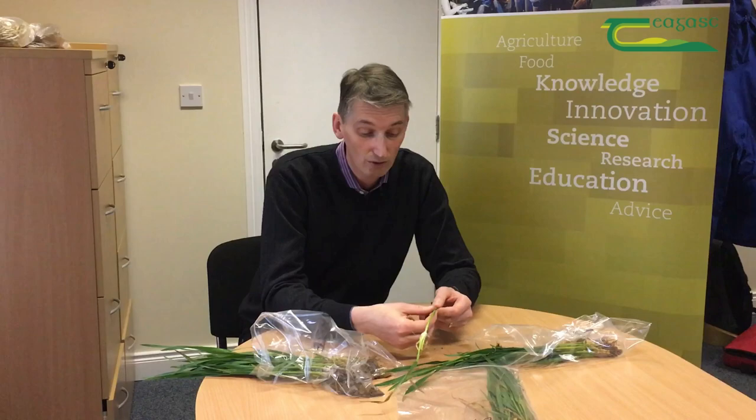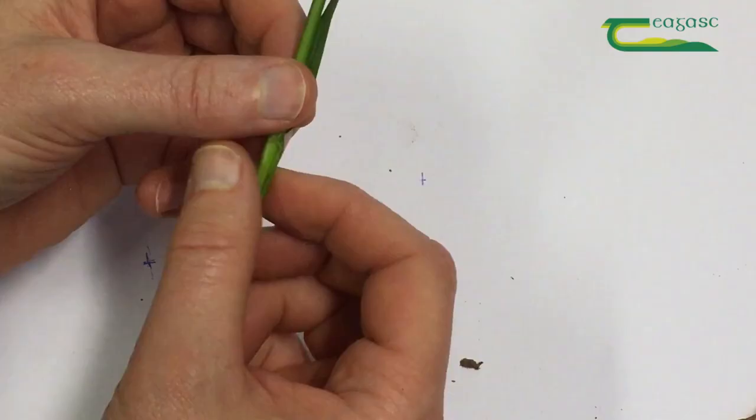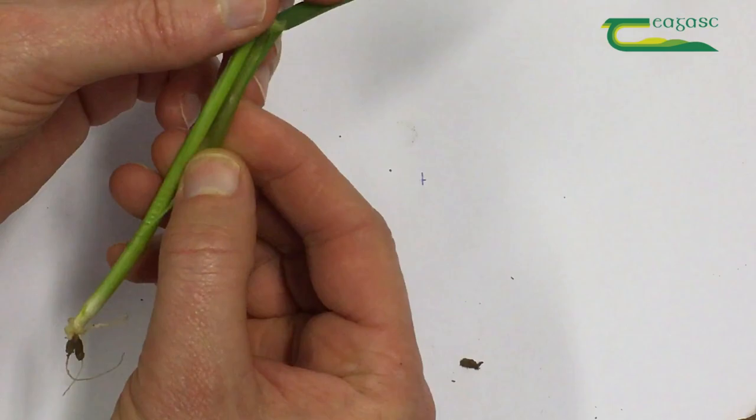I start at the back and have a look at the leaves and the way they're rolled around. In this case, that leaf is rolled around that way around the leaf inside. So unroll with one finger and roll out the leaf behind with your other hand, keep rolling it back out, and continue to roll out with the other finger rolling it back out.